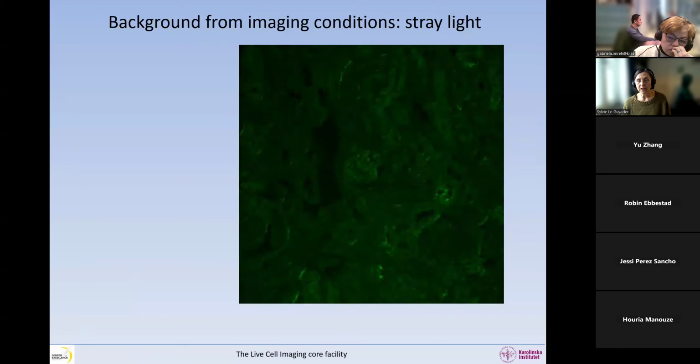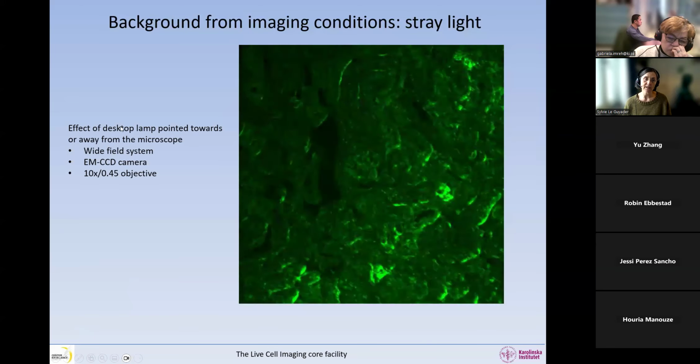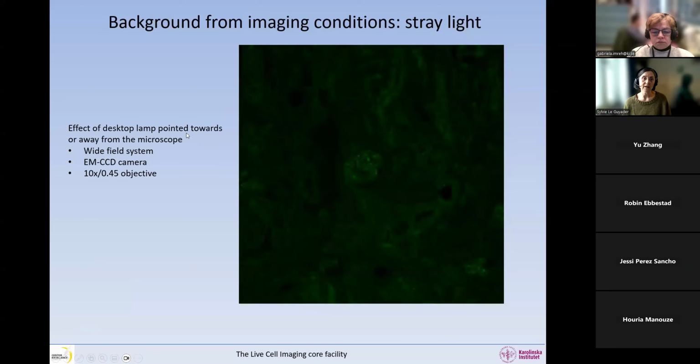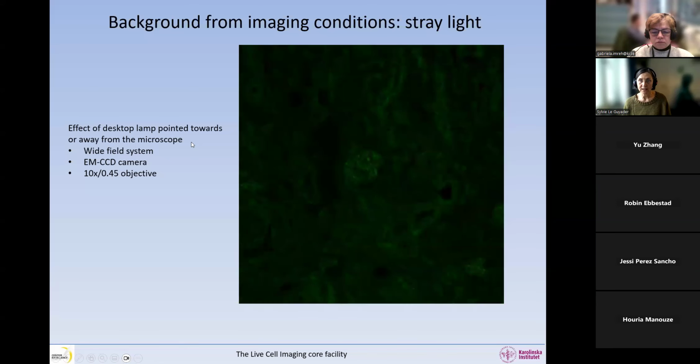It looks very much like we have either signal or no signal, a signal turning on and off, where actually what it is is a desktop lamp near the microscope that was either pointed towards or away from the microscope. So this is stray light. This is definitely something we do not want, and it's quite easy to deal with. Just turn off the light.